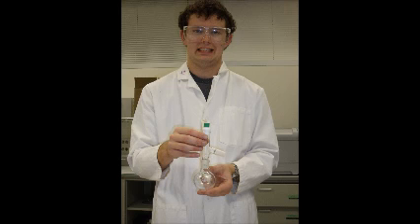After this, we need to connect the flask to the still head tightly. Normally, we would now insert the thermometer into the top of the still head, but before we can do that, we have to ensure that the thermometer is properly calibrated.